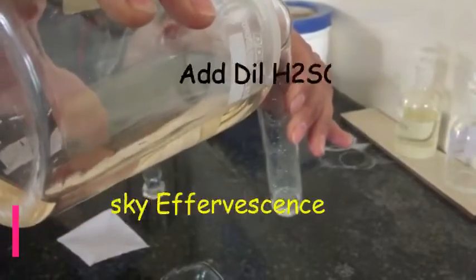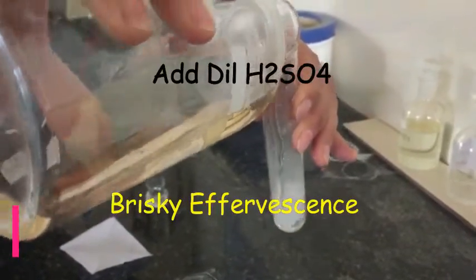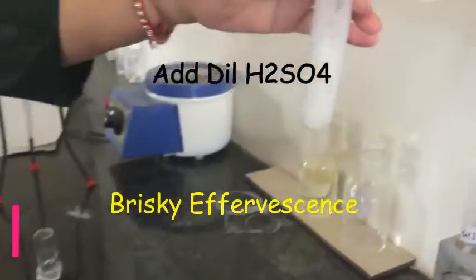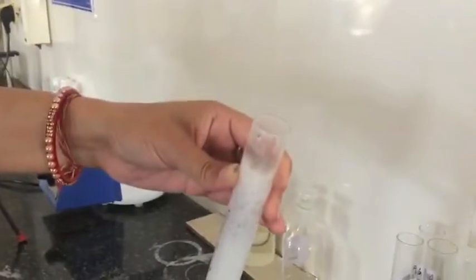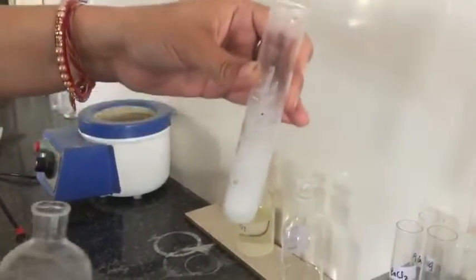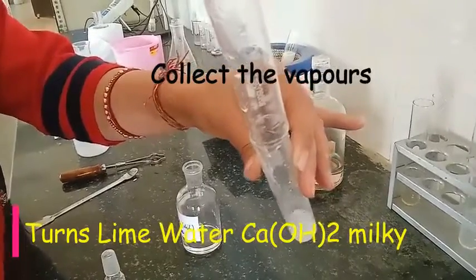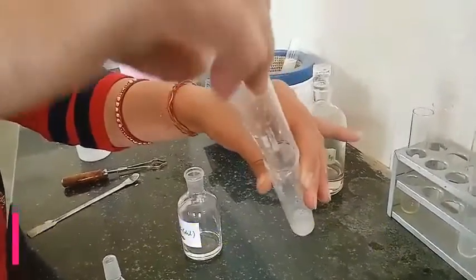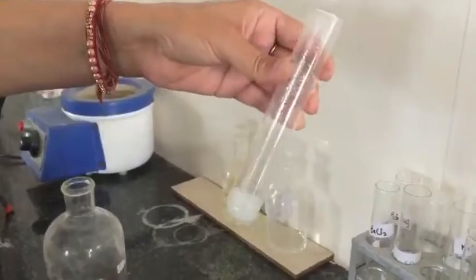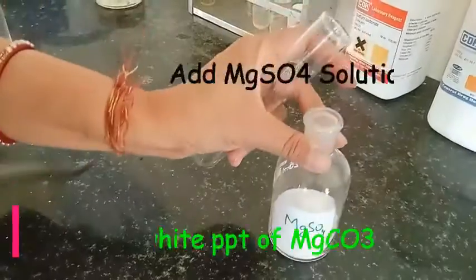Test for carbonate ions. We are adding dilute H₂SO₄ to the water extract of salt. It gives brisk effervescence, as you can see. If we collect these vapors into another test tube in this manner, it turns lime water milky — you can see here.